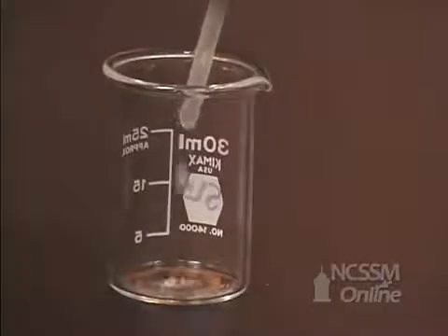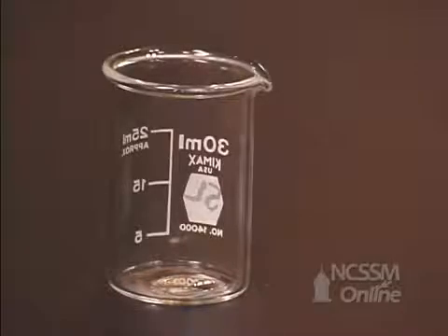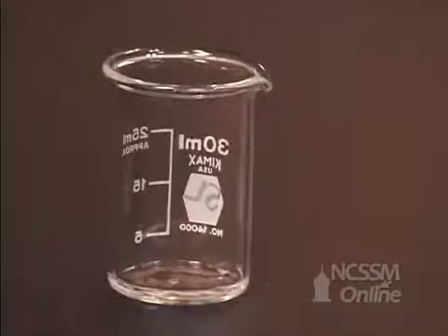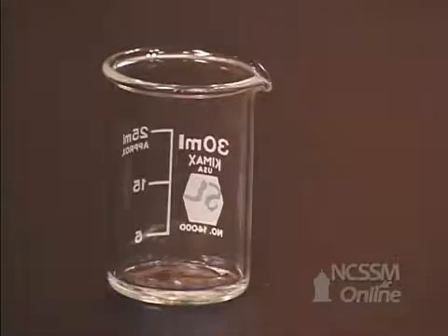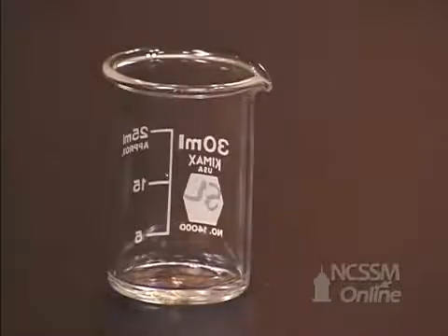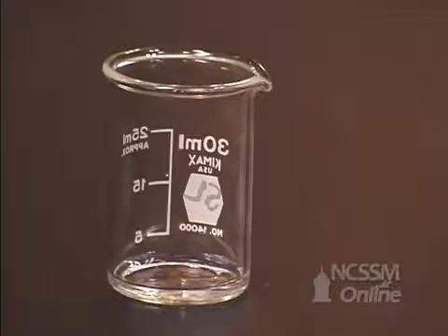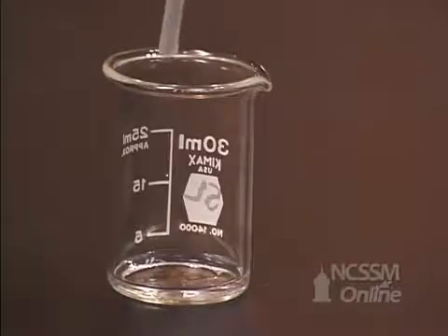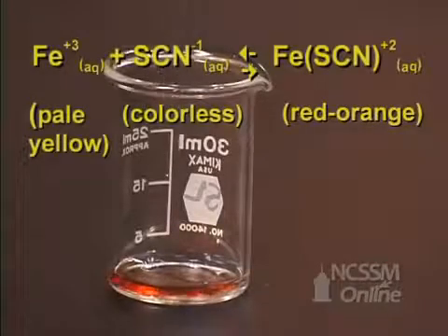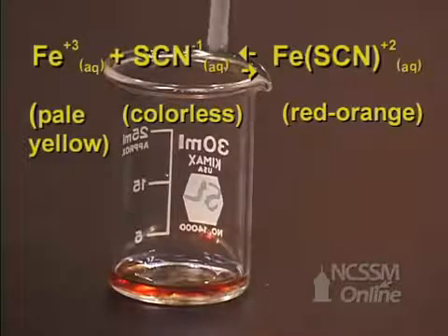In the reaction between iron(III) ion and thiocyanate ion, if we add some iron(III) in the form of iron(III) nitrate, and to the iron(III) nitrate add some potassium thiocyanate, the two react to form a reddish-orange complex ion.